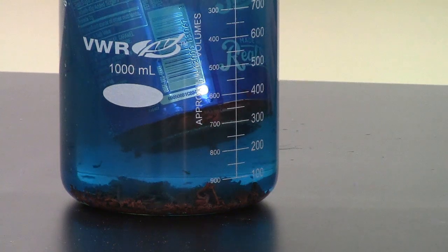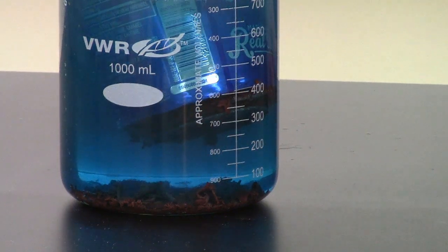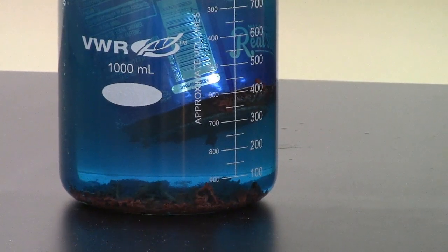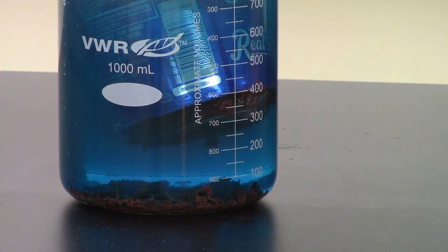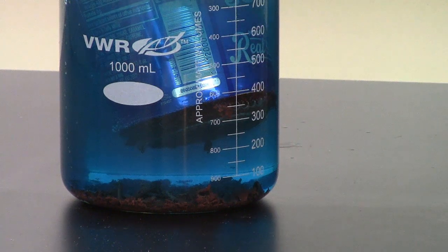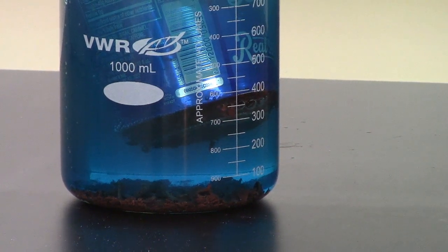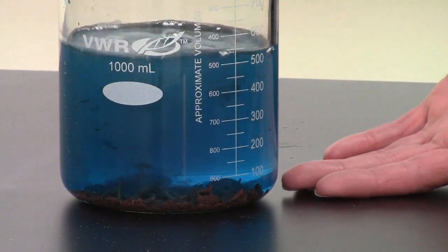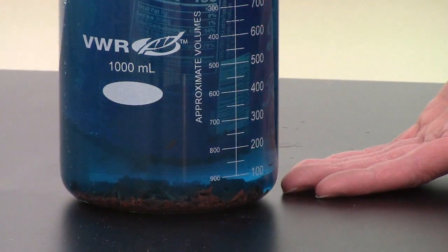Stop and think about, what do you think that is? It's obviously a solid. Well, we had aluminum coming in, and the other reactant was copper 2 chloride. So in a single replacement reaction, the aluminum and the copper that's in the copper 2 chloride are going to switch places. So the metal and the metal ions switch. So we've got copper metal that is starting to come out and land on the bottom.